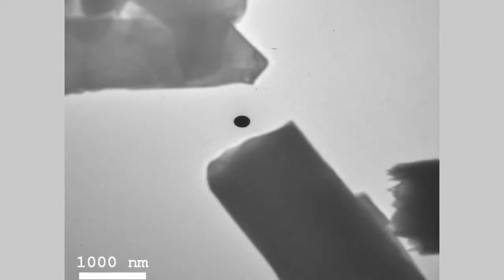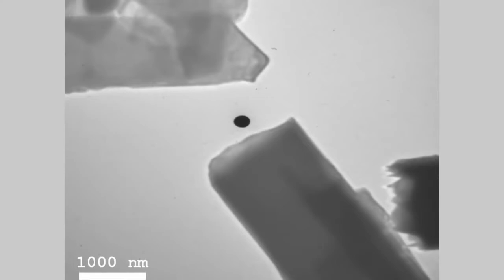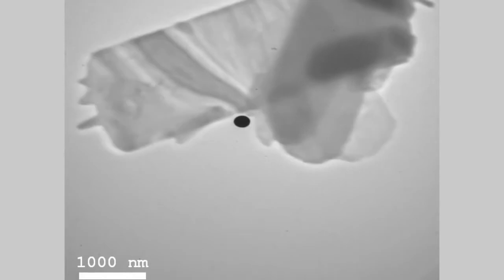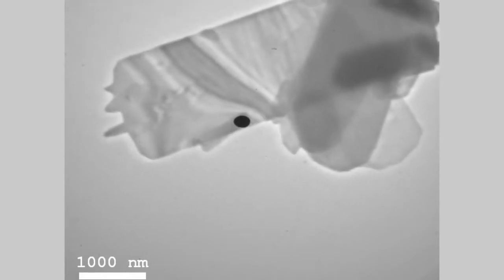So now I switch to the camera view, which you will see on the screen now. So the green has now become gray. And the black region here is the sample that's being observed. So this is the molybdenum trioxide crystal viewed in the TEM camera. What we have here is 4000 in magnification. And you can see with the scale bar on the screen that the width of this is almost 2 micrometers.